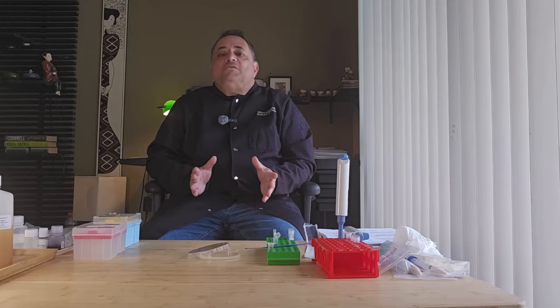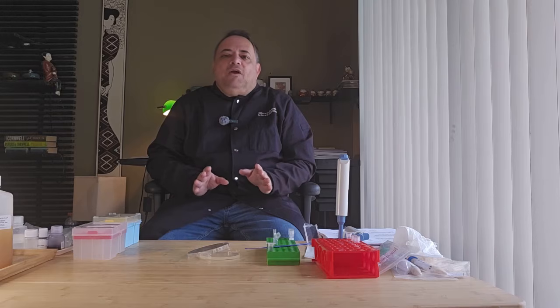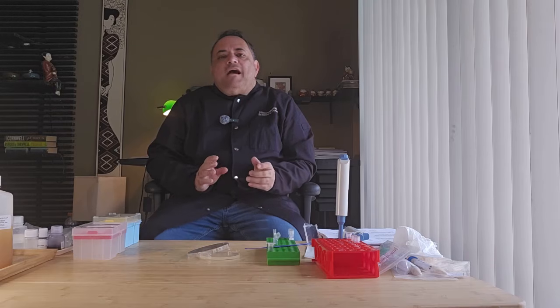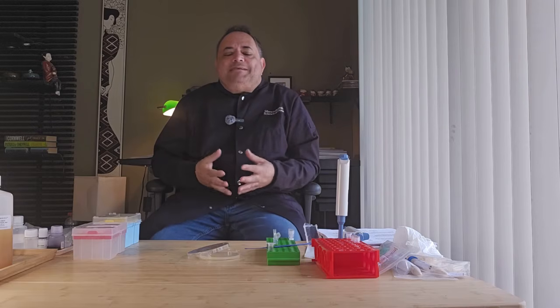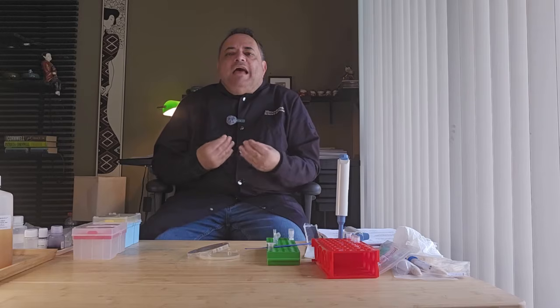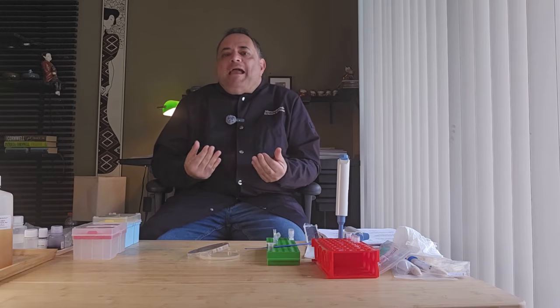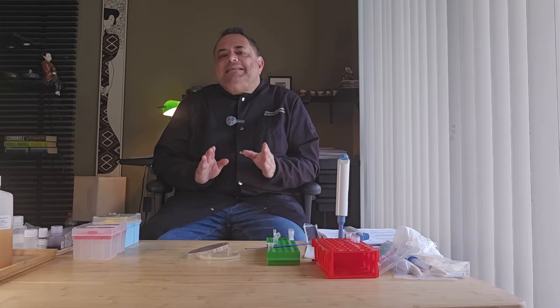While I'm stoked that the experiment worked and I was able to demonstrate a CRISPR editing reaction in my home lab, I hope you found that video interesting. The gene editing technique of CRISPR itself has enormous potential in medicine, agriculture, and biological research. But it also raises significant ethical concerns.